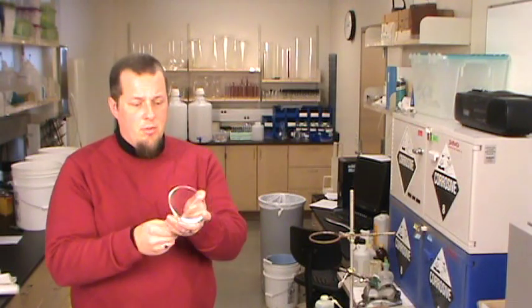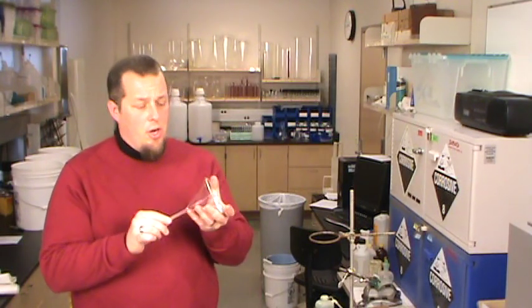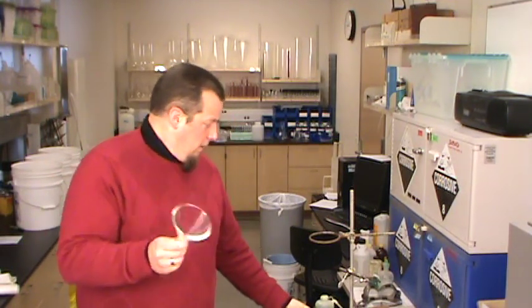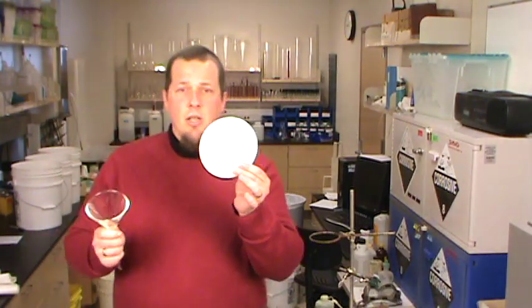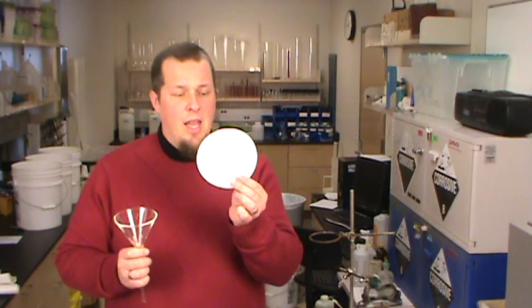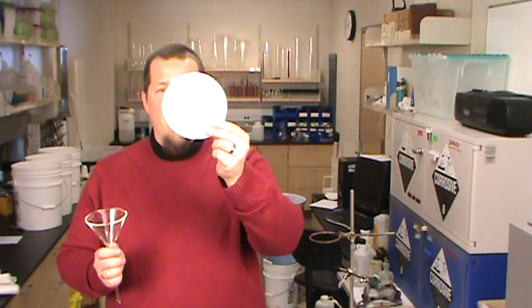Many times when we make a solid during a chemical reaction we need to remove that, and the easiest way to usually do that is by filtration. I think you've all seen one of these - it's just a glass funnel. There should be one in all of your lab drawers. The problem comes in with the filter paper - how do I get this flat round piece of filter paper to fit in that cone shaped funnel?